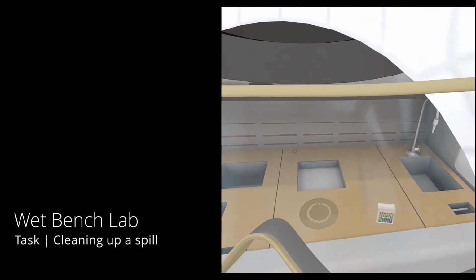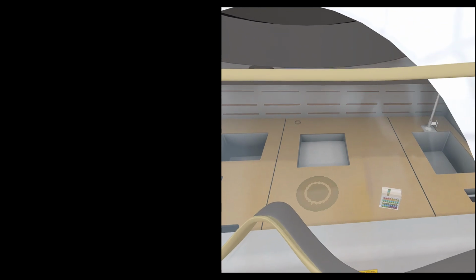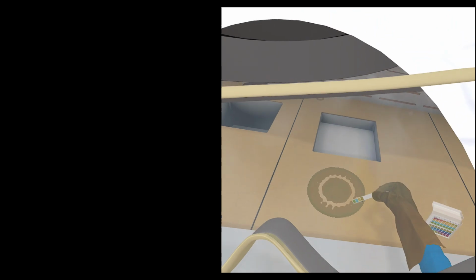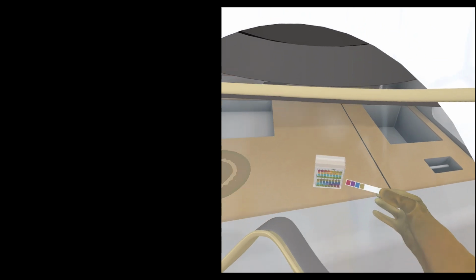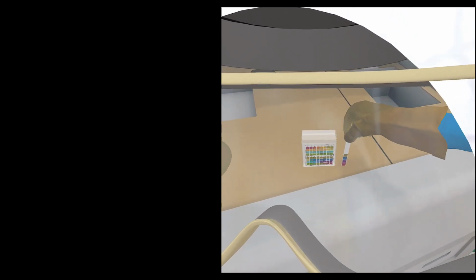Grab a pH strip. Then test the spill by putting the strip into the spill. Now read the strip color change against the scale on the box. Remember that an acid has a pH of less than 7 and bases have a pH greater than 7.